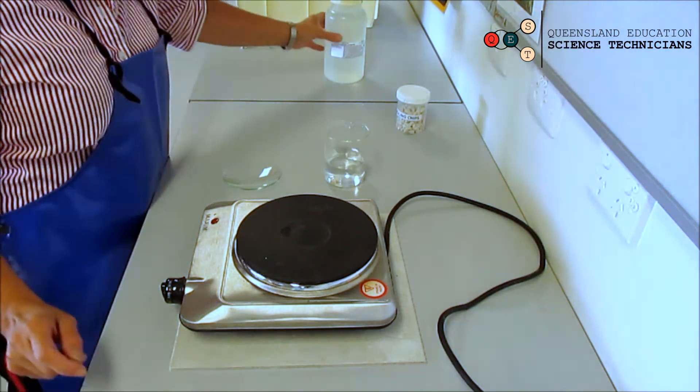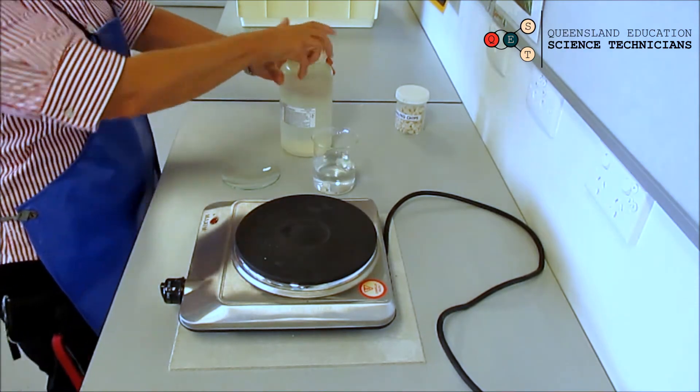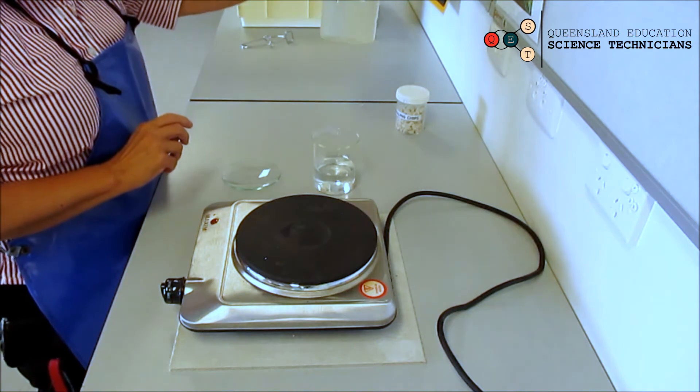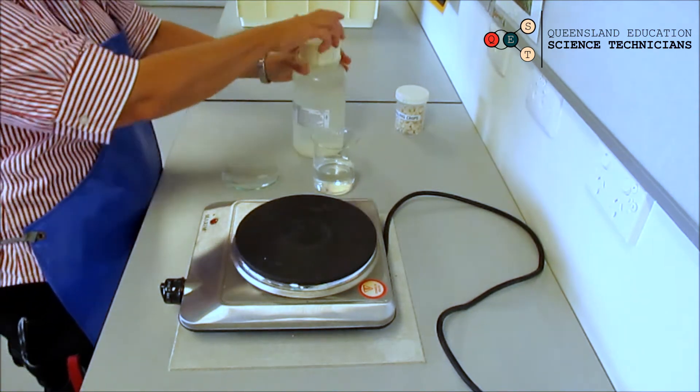Now the boiling chips help with making sure that the water doesn't splutter around. Then your teacher will also come around with some sodium chloride solution, so salt solution, salt in water.